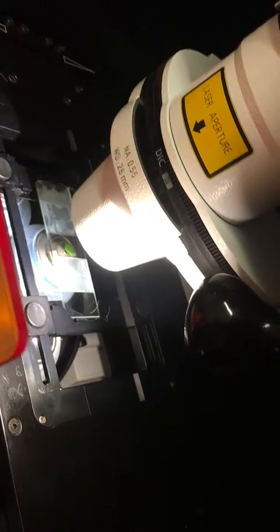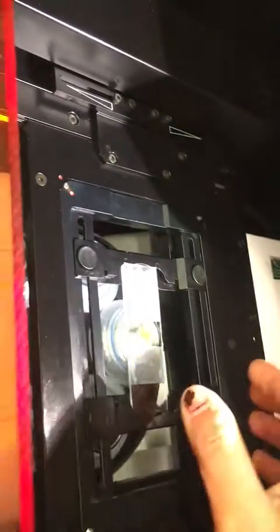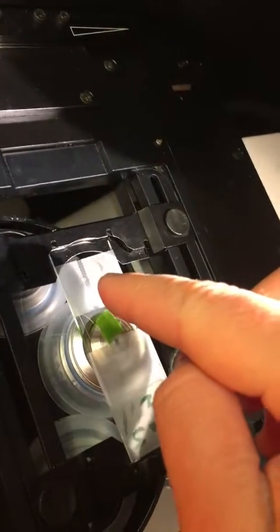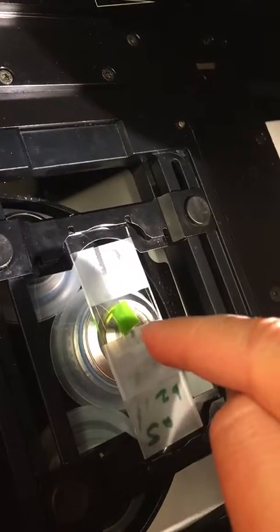These two positions are very useful when you want to swap your samples. For example, I'm using an immersion lens 40 times, and I'm done with the sample, so I just take it off and pick a new one. If I mount it like this, my sample is not placed above the lens, so I will not be able to image. And if I move the stage, I will smear all the immersion all the way around.